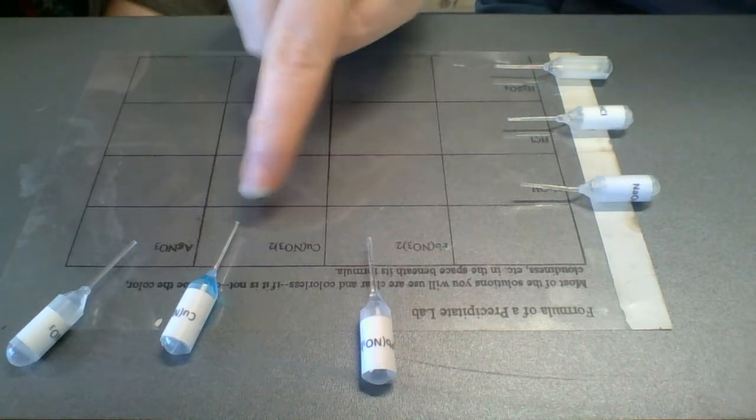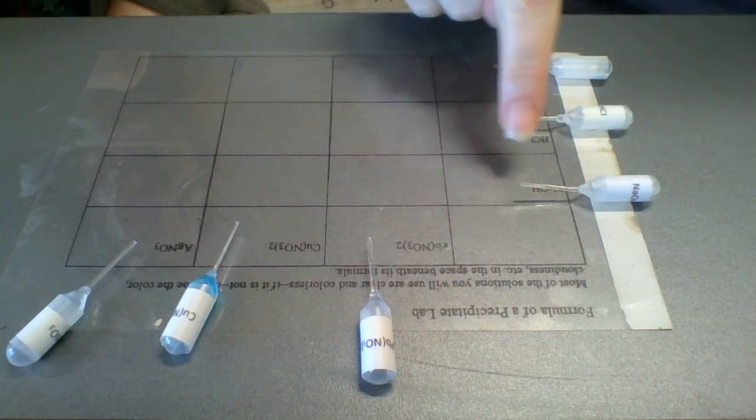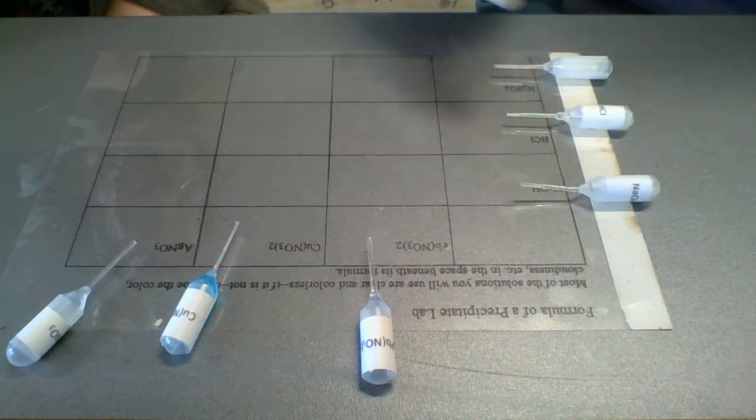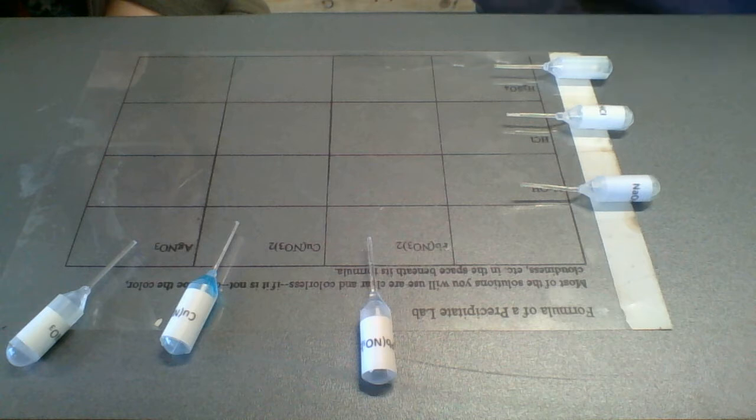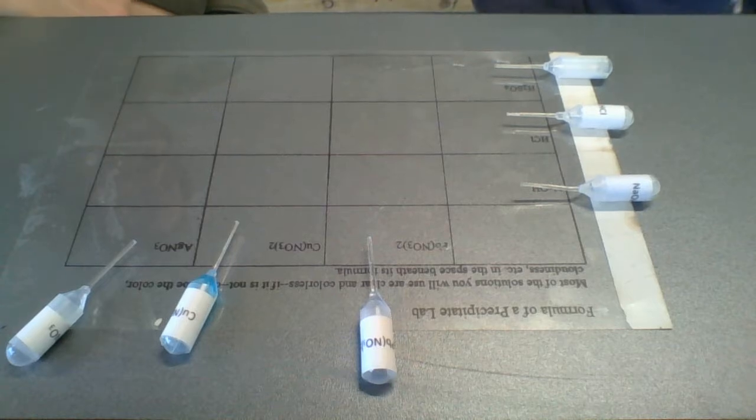And we put the nitrates on the top, and then we put our extras: sodium hydroxide, hydrochloric acid, sulfuric acid, and those should all be listed on the form that you've already printed out, hopefully. Yeah, and if you don't have it printed out or opened up, go ahead and pause the video, pull that up so you can follow along. And all we're going to do is just mix. Okay, so basically we're doing reactions.